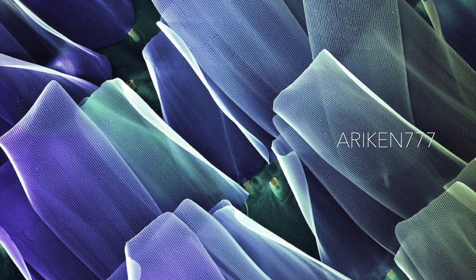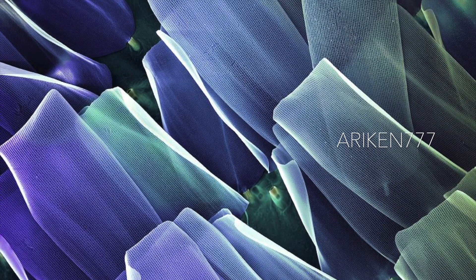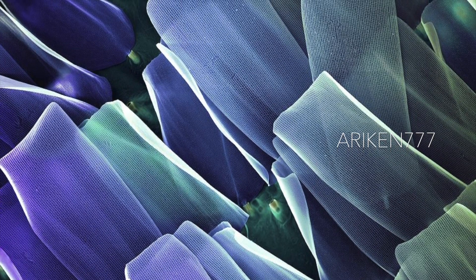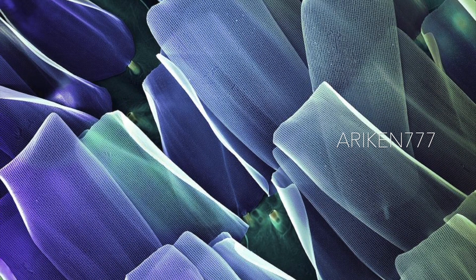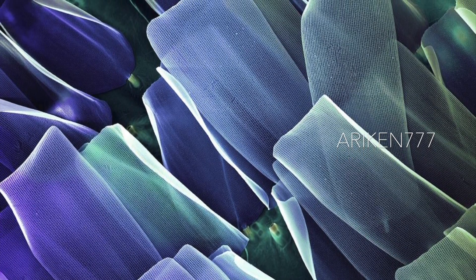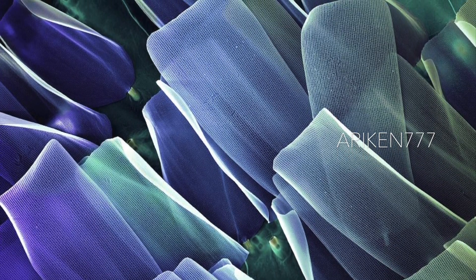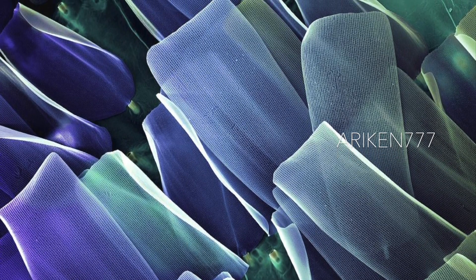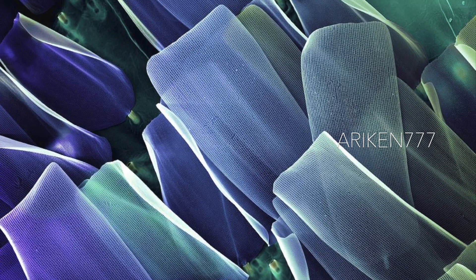These are the wing scales of a Ulysses butterfly, also commonly known as the blue emperor. Ulysses are large swallowtail butterflies found in Australia, Indonesia, Papua New Guinea, and the Solomon Islands. Their wingspan is typically about 5.5 inches. The upper side of the wings is an iridescent electric blue, and the underside is a more subdued black and brown — these colors are produced by the microscopic structure of the scales, a phenomenon called structural coloration.